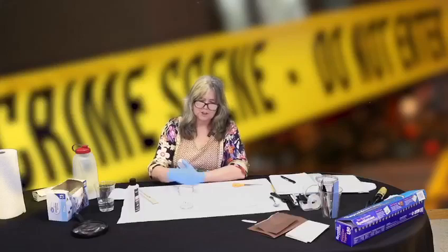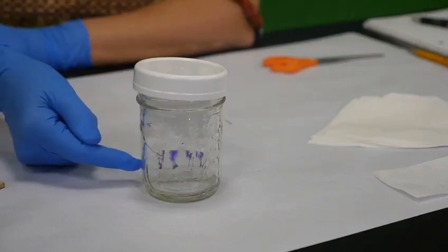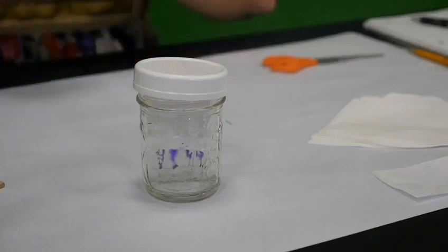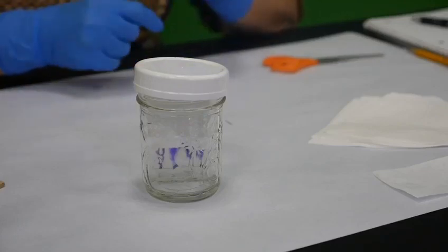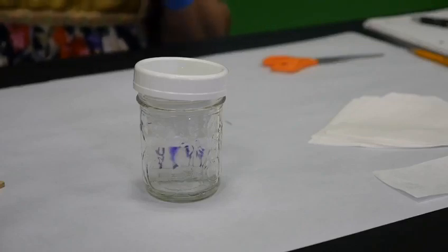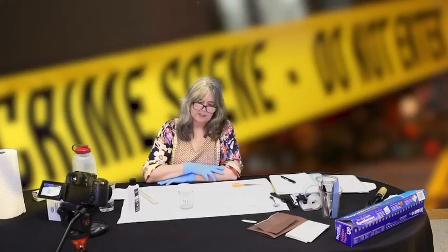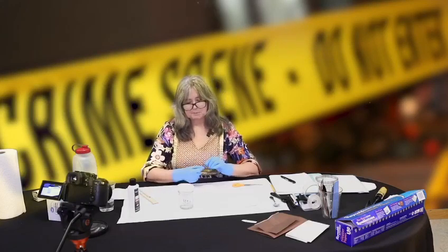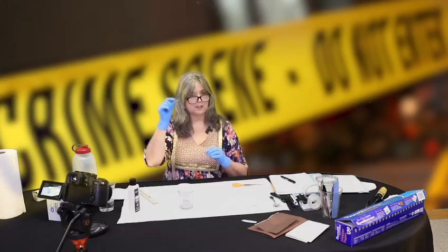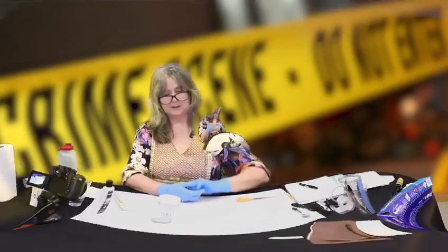I don't want the solvent to go above this line, so I'm going to make sure the solvent level is well below the line, make my paper nice and straight, and put it in the jar. You can already see that the ink spots are starting to climb. The acetone-water mixture rises up the paper — this is called the solvent front — and the inks flow with it. I'm going to put the lid on, because the vapor inside the chamber is also important. It's like a wick: the solvent absorbs up the height of the paper. If the inks are soluble in the solvent, they'll go up with it, and if an ink is made of a mixture of different things, some will flow faster than others, and we'll hopefully get some separation and see spots with different colors.